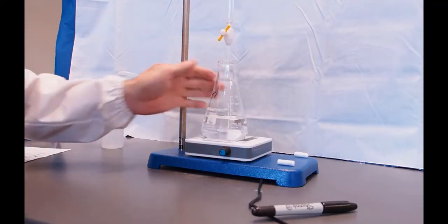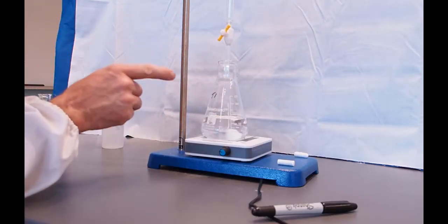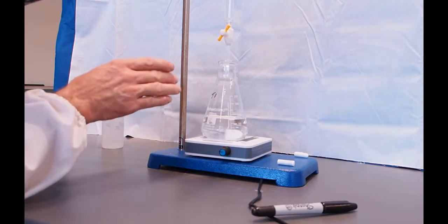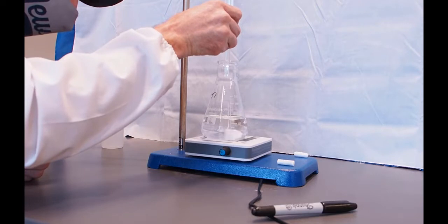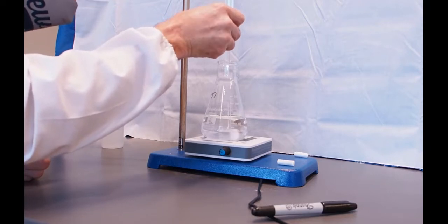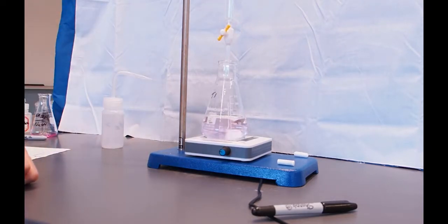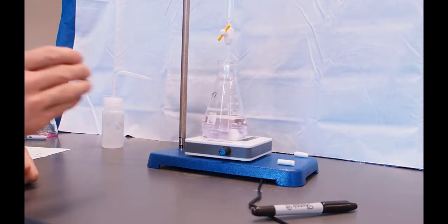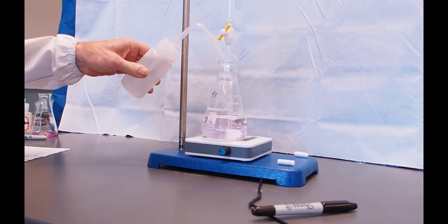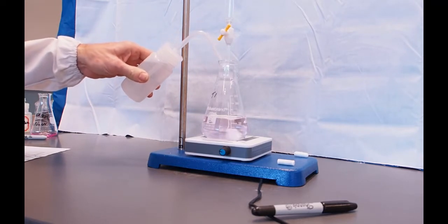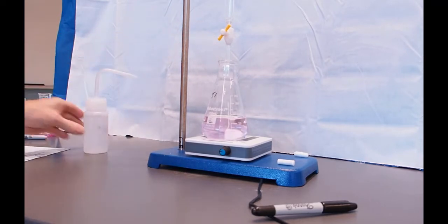Okay, so we are very close to the end point. I'm going to go one drop at a time until the color changes. So very carefully, I'm just going to barely open that stopcock. And there, I had one drop. And I can see a very faint pink. A half a more drop. And it's pink.